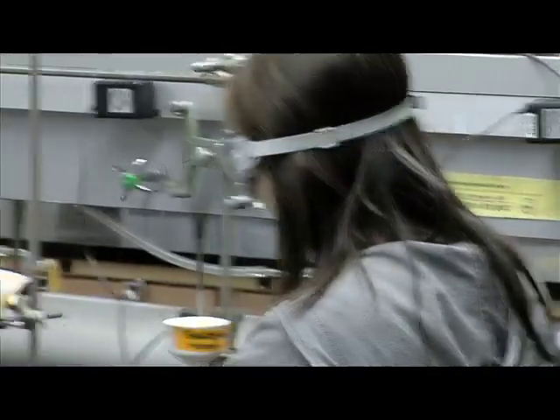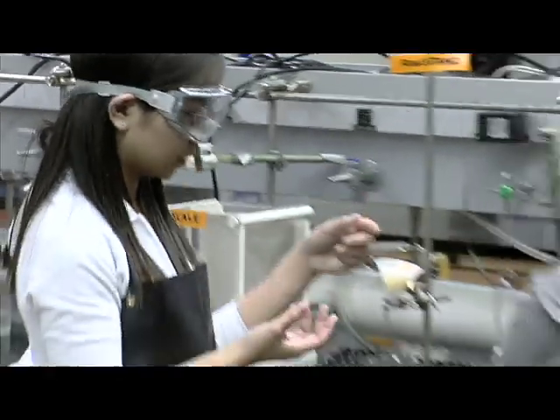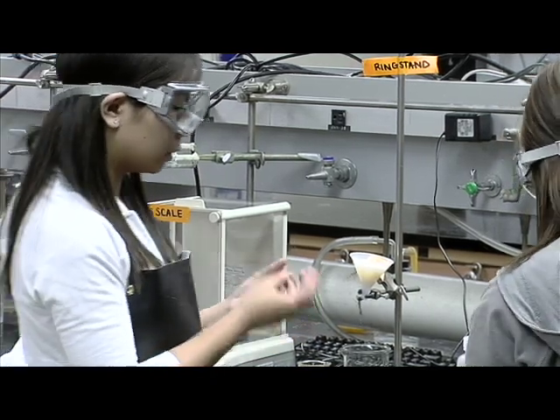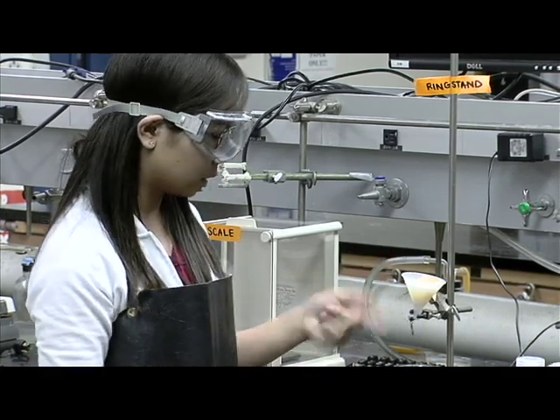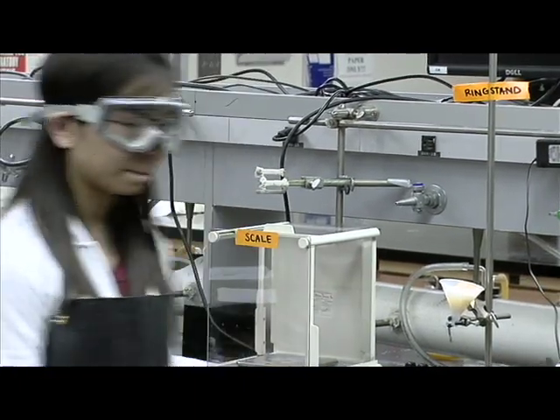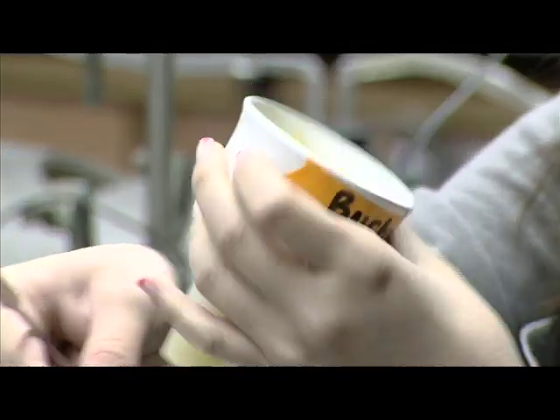All the liquid is down, so I'm going to turn off the vacuum. My filtration is not done yet because all the liquid hasn't been poured down. I have to wait until everything is dripping down so I will be left with the precipitate only. You can see that because of the vacuum, all the liquid is removed, and what we have left is the precipitate, which I'll take out.